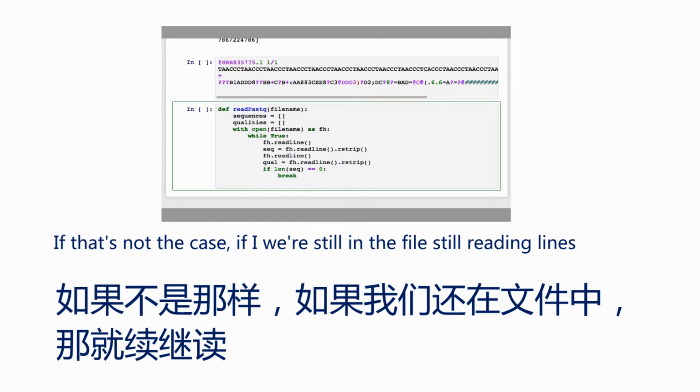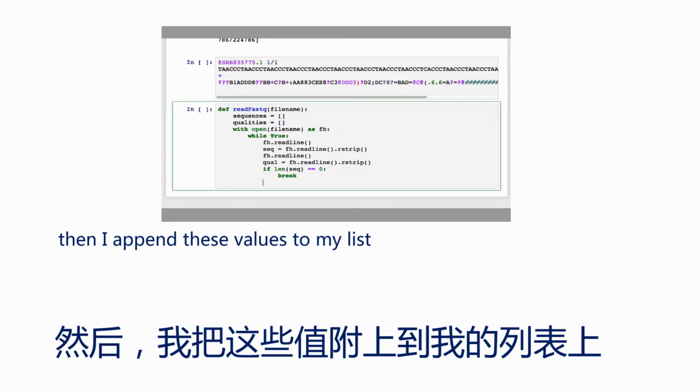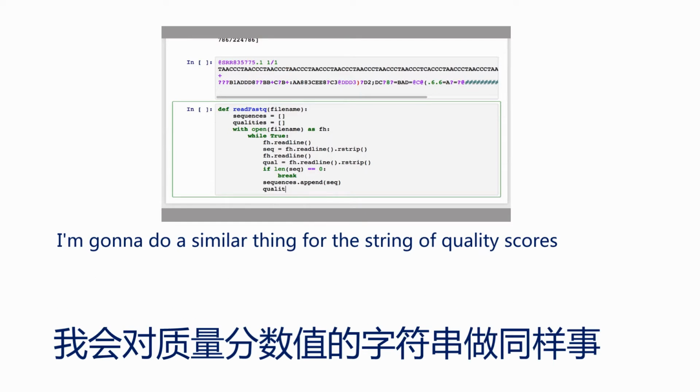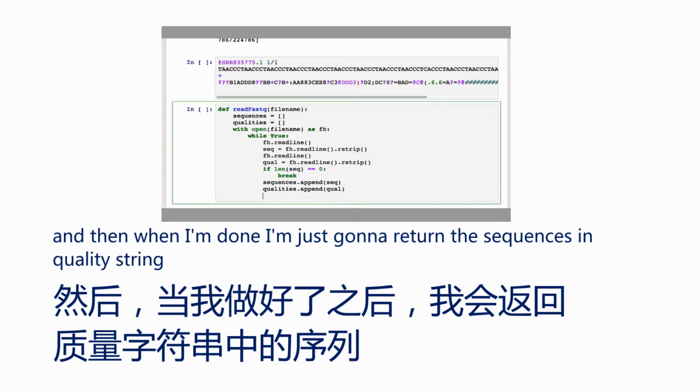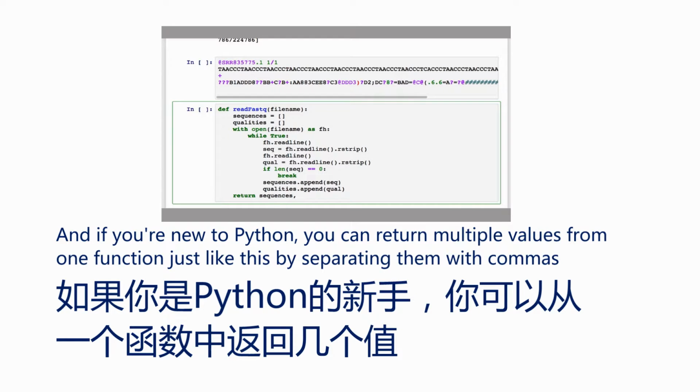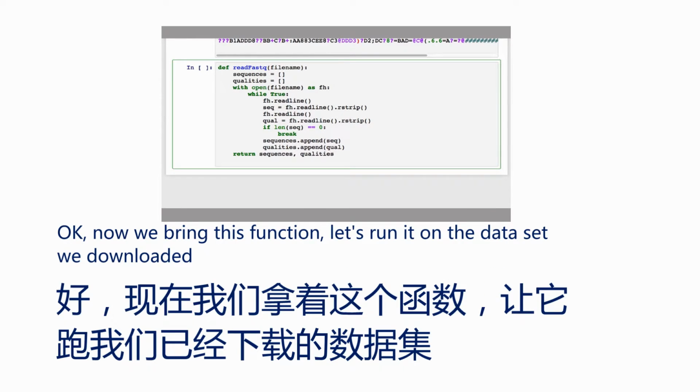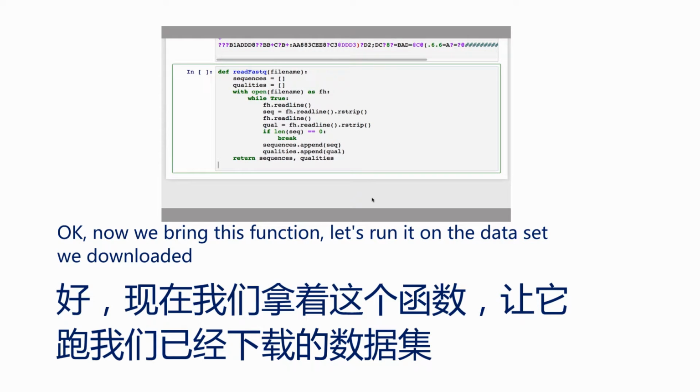If that's not the case, if we're still in the file, still reading lines, then I want to append these values to my list. So I'm going to do sequences.append the sequence that I read, and I'm going to do a similar thing for the string of quality scores that I read. And then when I'm done, I'm just going to return the sequences and quality strings. And if you're new to Python, you can return multiple values from one function just like this by separating them with commas.